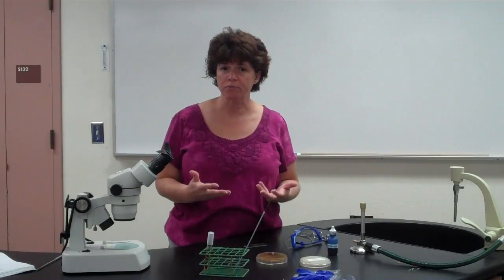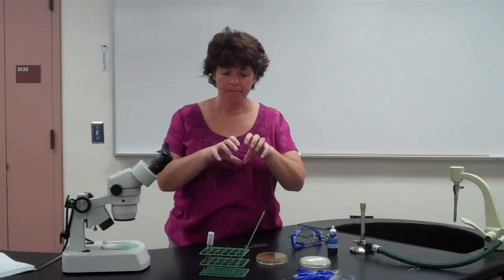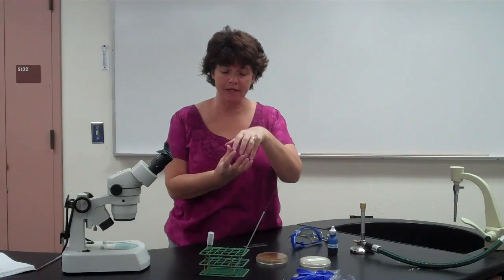There are the zygospores. Not so much a sac, but you see the 2 filaments coming together and then they're inside of that when they fuse together, the positive and negative cells. And then the ascospores, where they're literally what looks like a sac. And that's similar to what we will also see with some of the yeast if they have sexual reproduction.